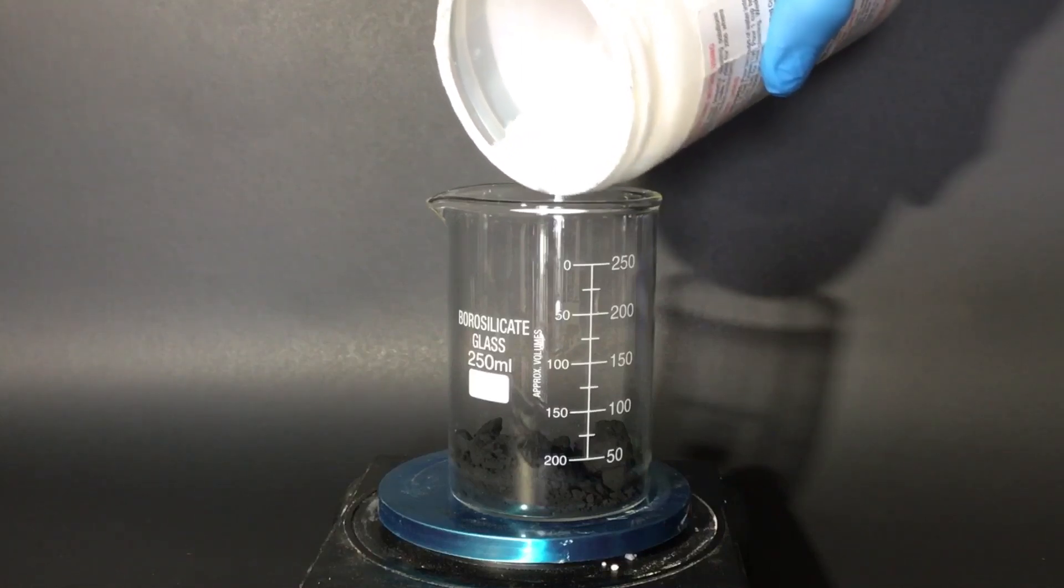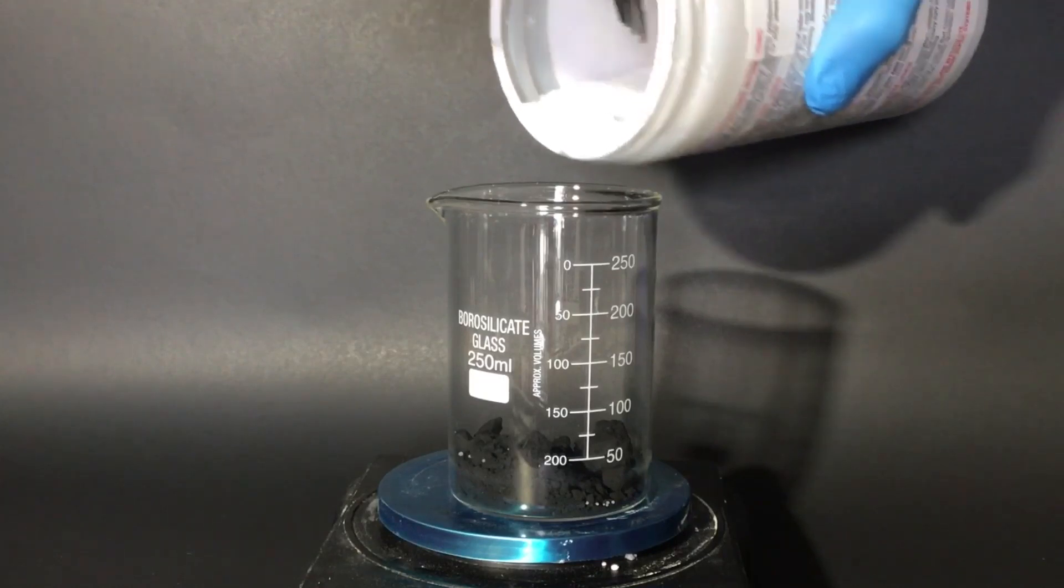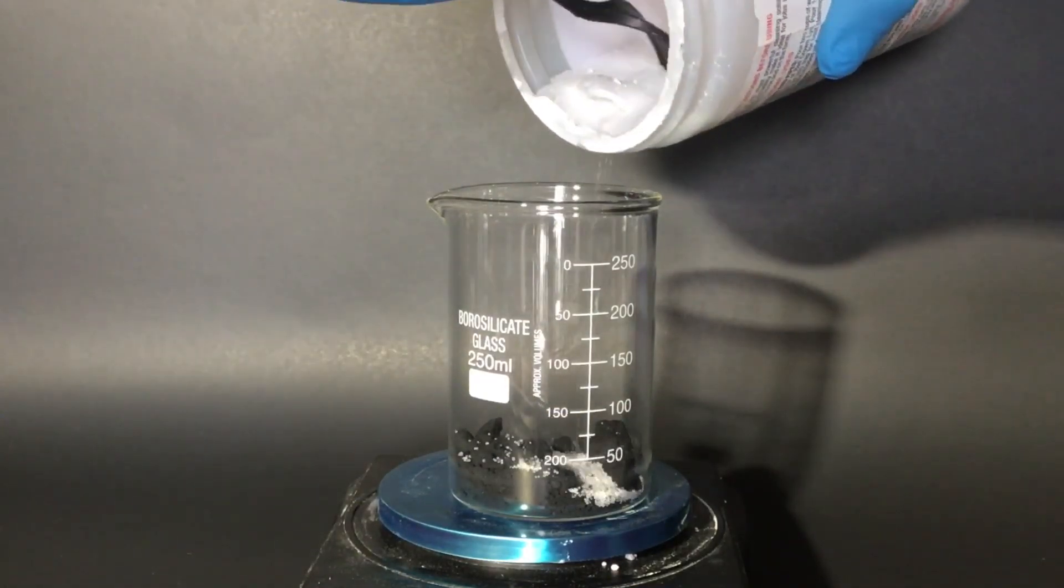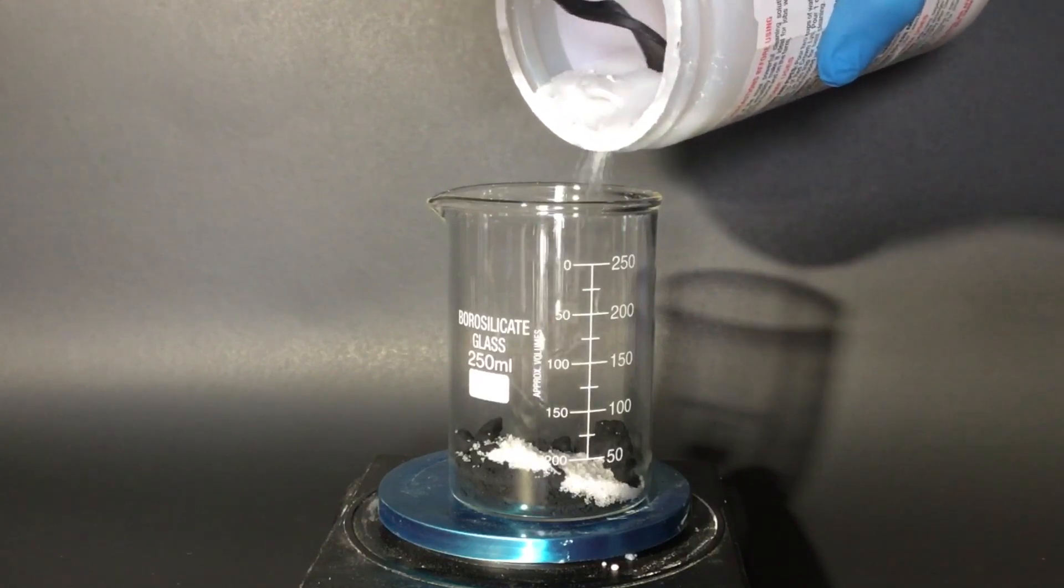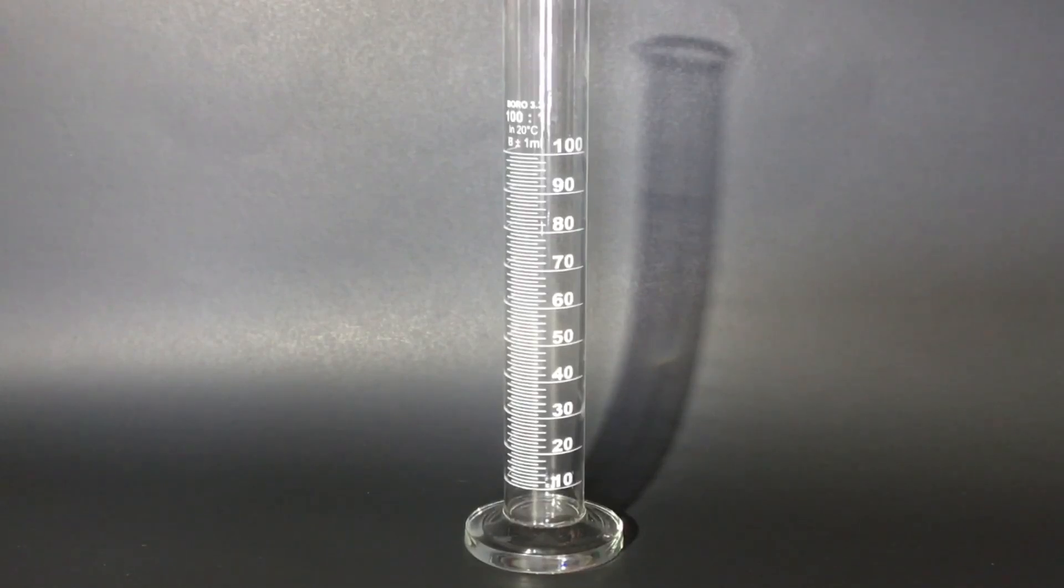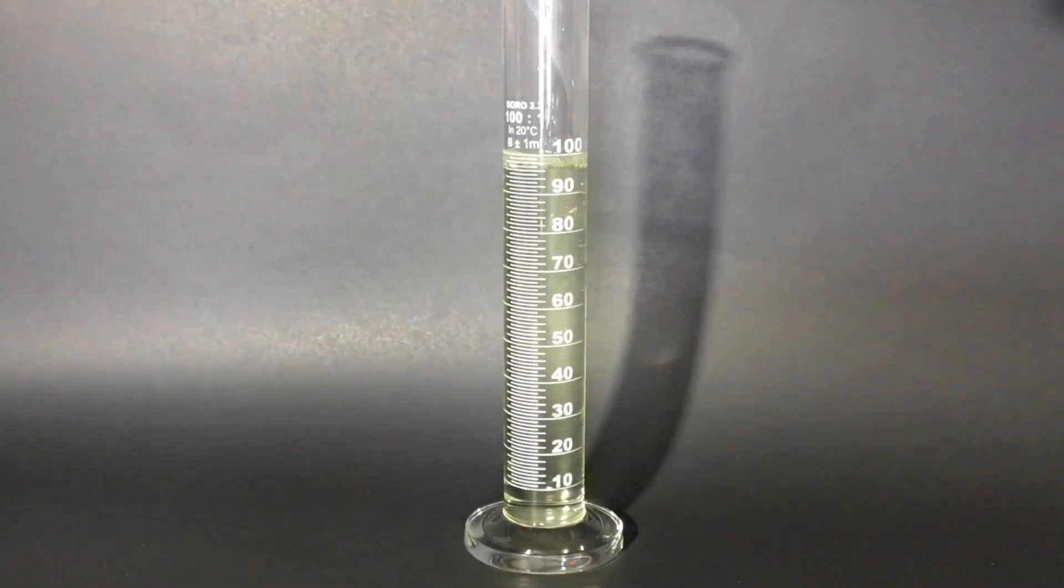I add in the sodium hydroxide to the manganese dioxide and measure out all of the bleach. I'm using 7.5% and 500 mL of it, which should equal around 37.5 grams of sodium hypochlorite. I measure it all out in graduated cylinders because I just got new ones and I'm really happy that I have them, and I add it all into a beaker.